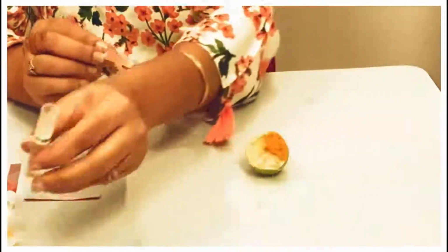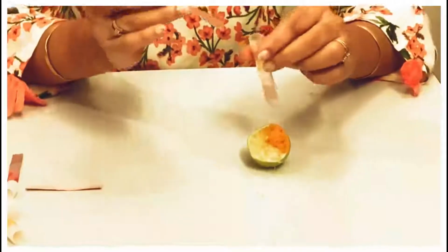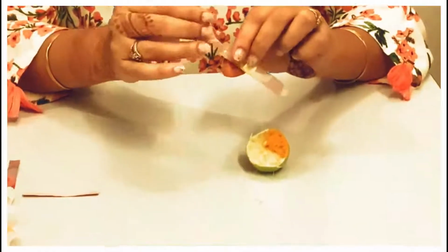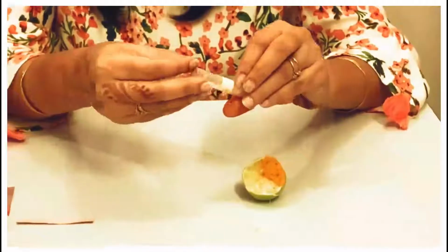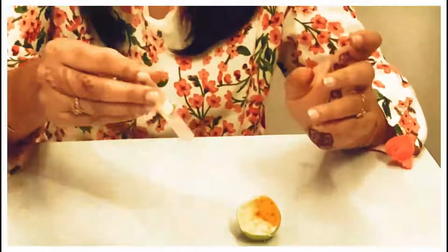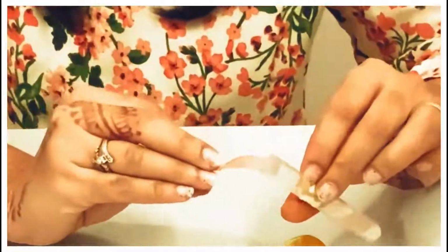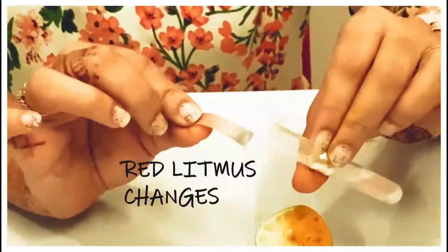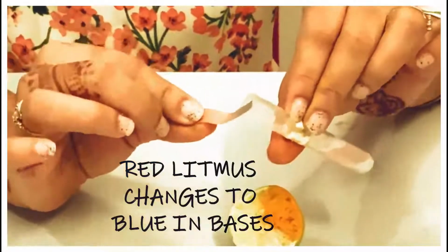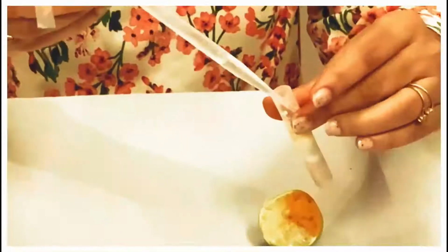But when we dip this red litmus into the base solution, that is the detergent we have taken as sample, let us see what happens. Just check it out. Can you see this red litmus start changing into blue? Let me make more of the solution so that I can dip it conveniently.